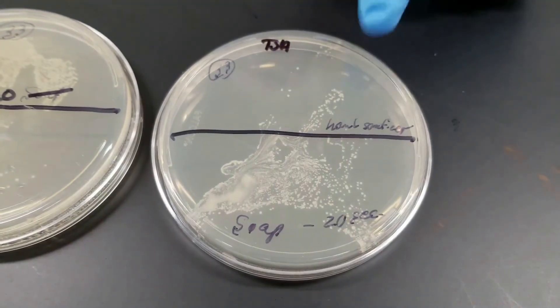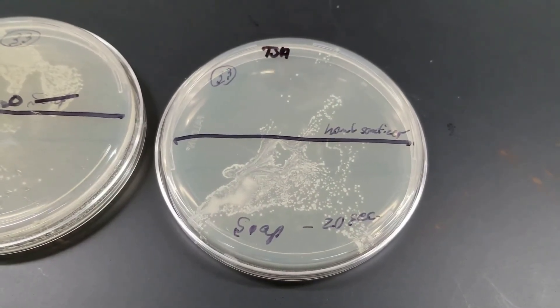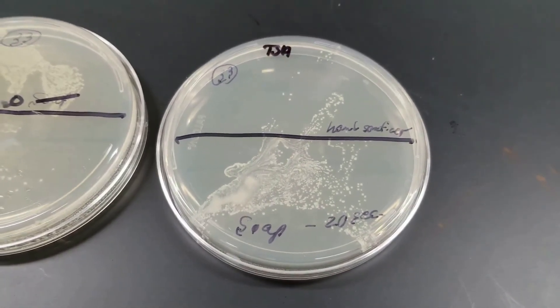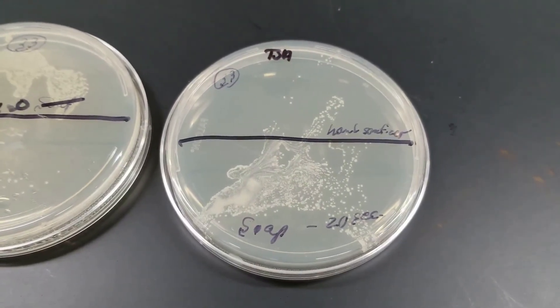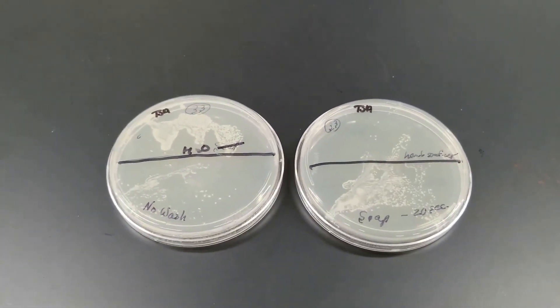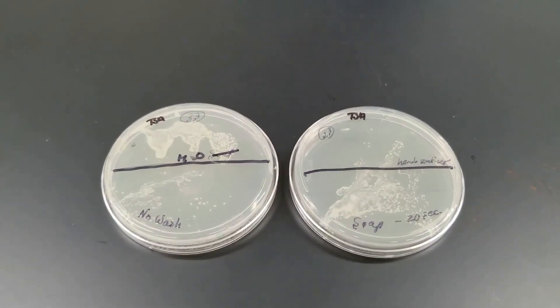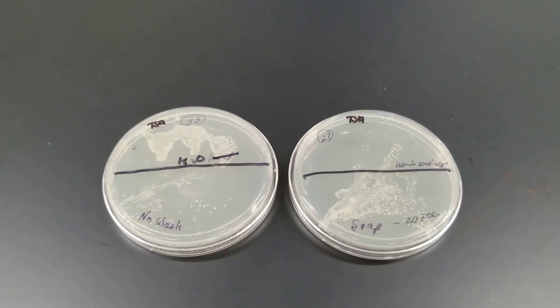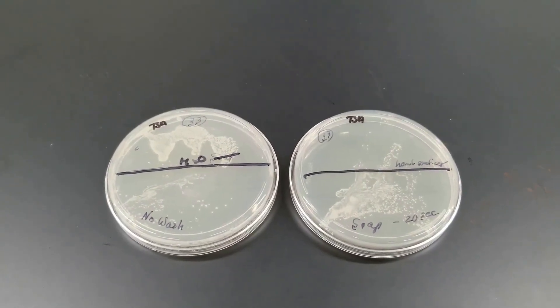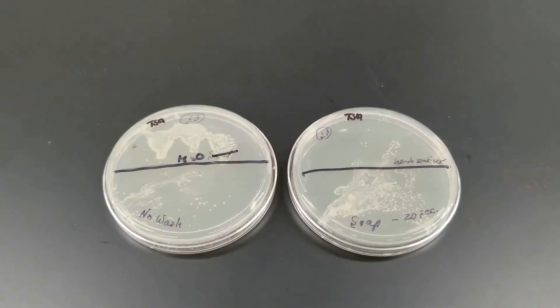This upper quadrant is where I used hand sanitizer. Once again, how many people have touched the top of the hand sanitizer dispenser? Just some things to keep in mind — be aware of cross-contamination. I really want to stress this: we are filming this particular lab during the COVID-19 pandemic. I want to stress the importance of hand washing, and also the importance of being aware that when you touch one substance and go touch something else, you could be transmitting those microorganisms from one location to another. So just wash your hands. Thank you.